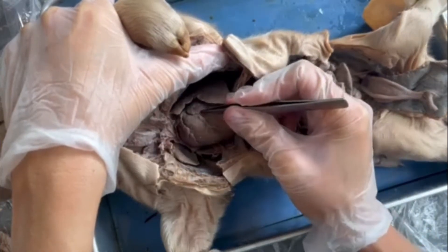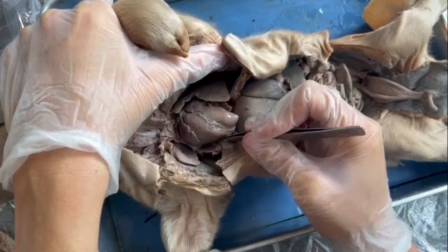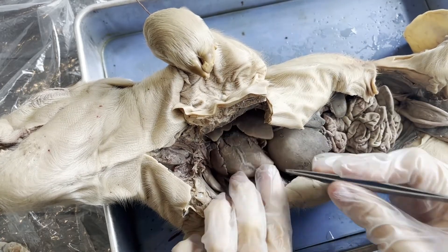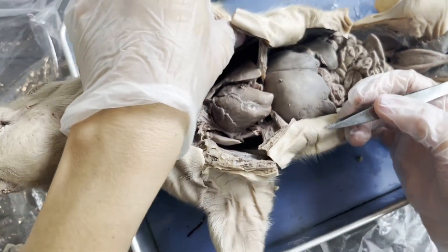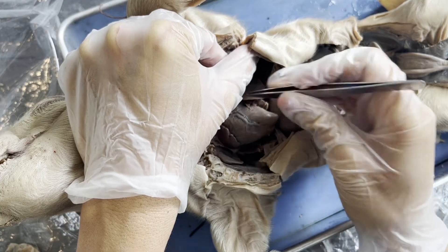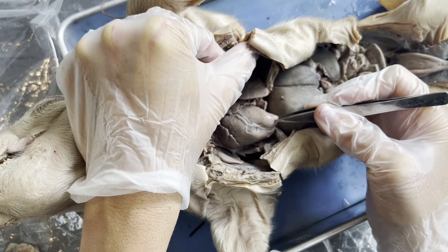For simplicity's sake, we are going to say everything to the left of the coronary artery is the left side of the heart, and everything to the right of the coronary artery is the right side of the heart. The heart in a mammal has four chambers — two top chambers and two bottom chambers. The top chambers are called atria. Generally, this is our right atrium at the top right, and this is our right ventricle. This is our left atrium over here, and this is our left ventricle down here near the apex, or the point of the heart.